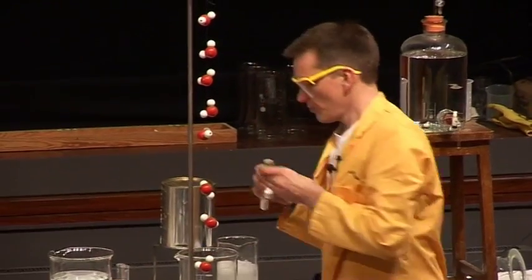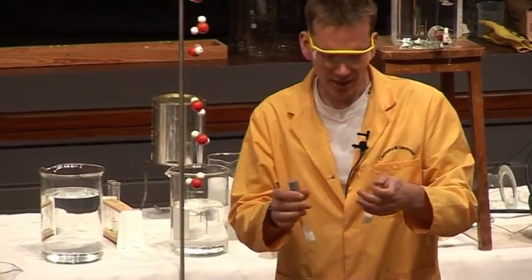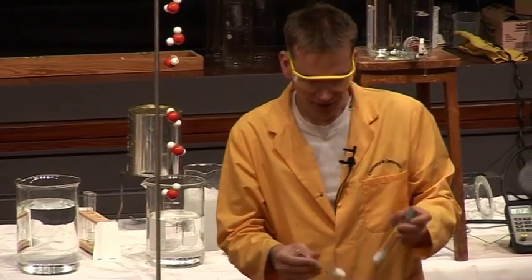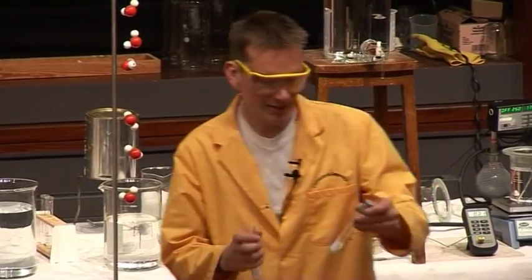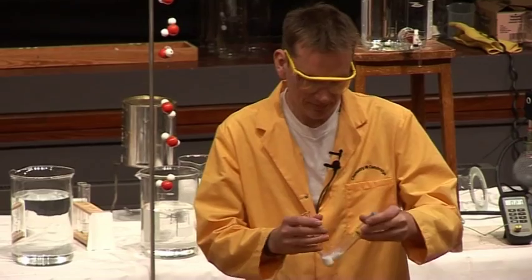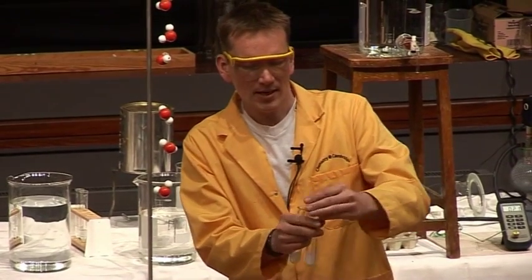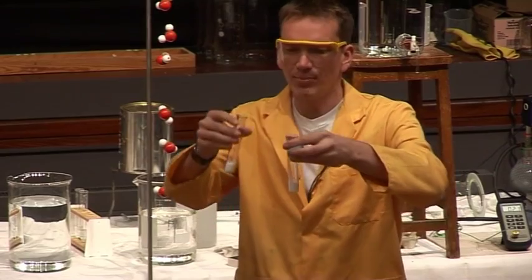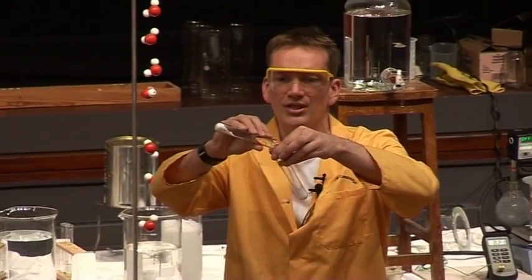I have two solids here — potassium iodide and lead nitrate. Just mix them together. When I mix these we should see a reaction taking place. I'm going to pour the two solids together.